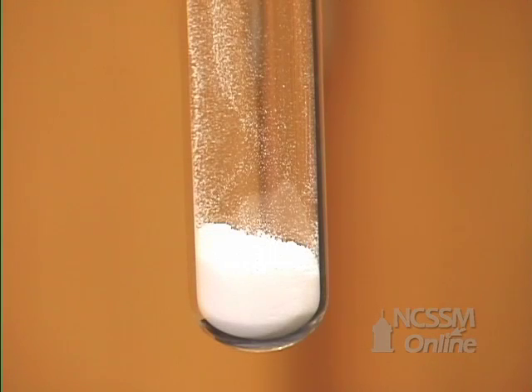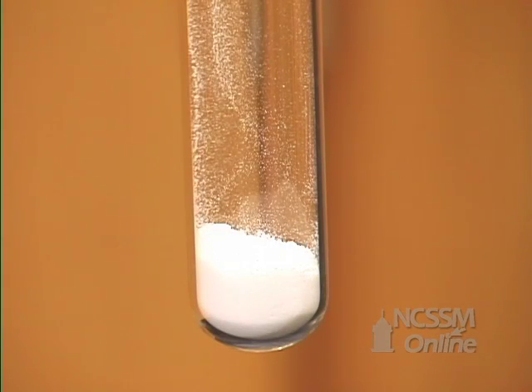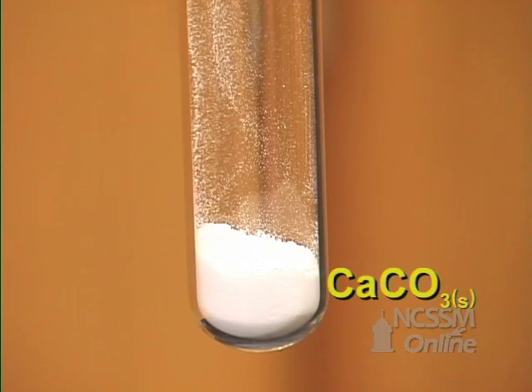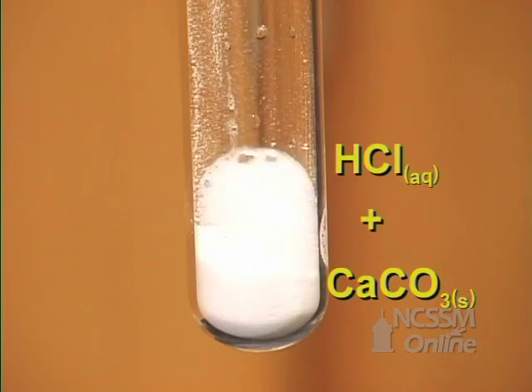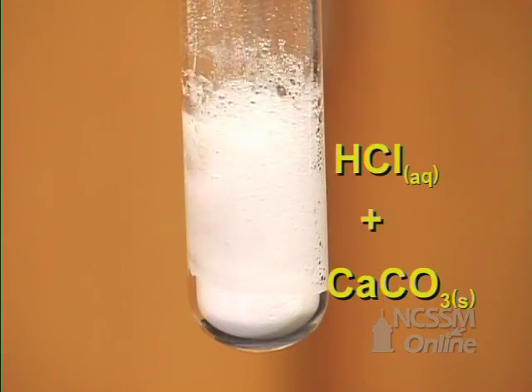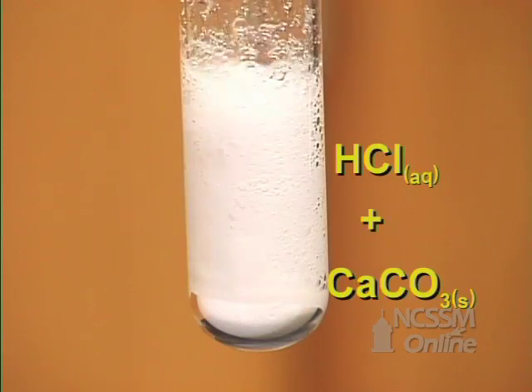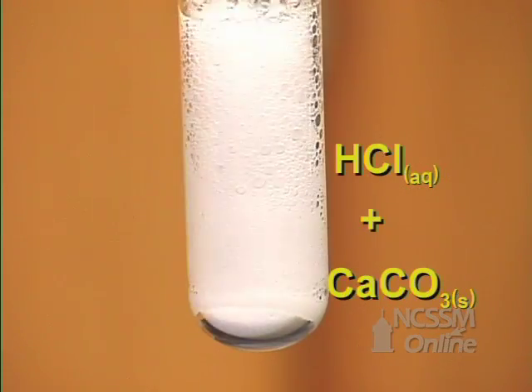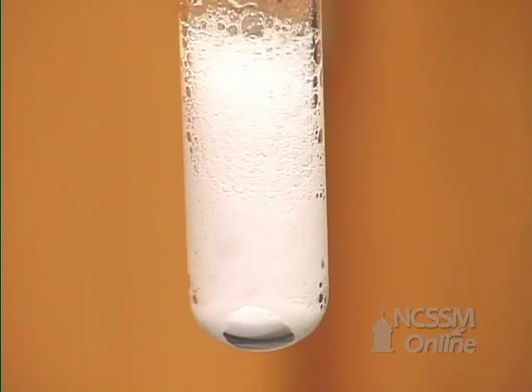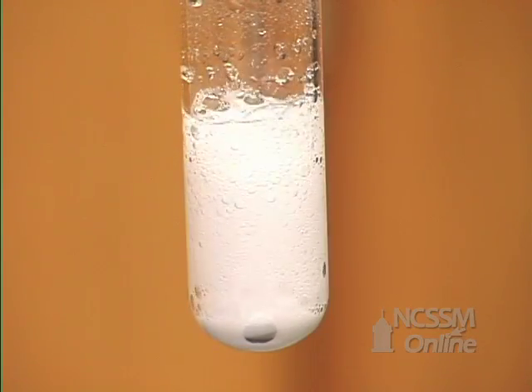In the double displacement reaction of a metal carbonate and an acid, we will start out with white calcium carbonate and add a solution of hydrochloric acid. The calcium carbonate and the hydrochloric acid react rapidly to form carbon dioxide, water, and calcium chloride.